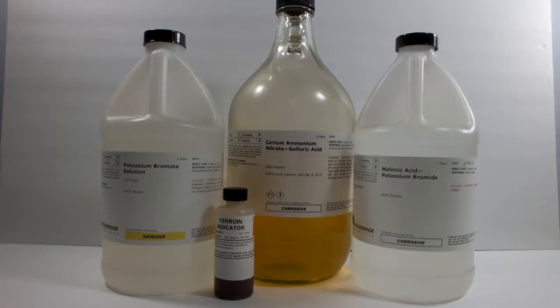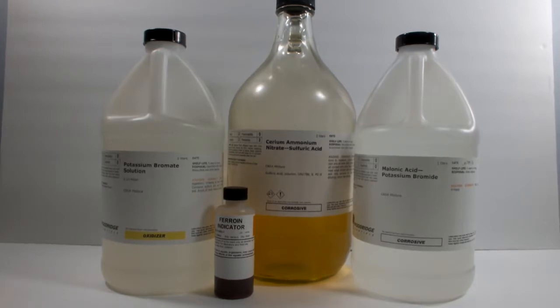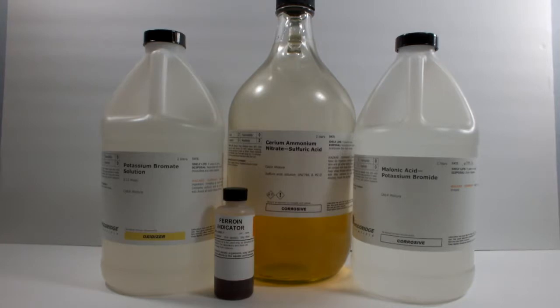Continuing from the previous video, I have two more Belousov-Zhabotinsky reaction variants to test out. This first one was planned to be part of the chemistry demonstration show I used to perform. I made a whole lot of solution, but it turns out that the reaction takes too much time to work it into an hour-long show. So these giant bottles have been eating up all sorts of space in storage.